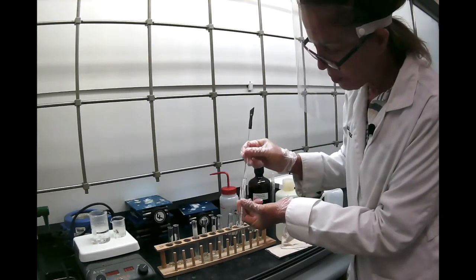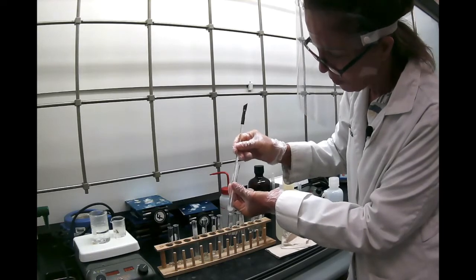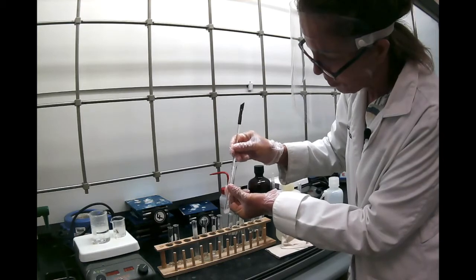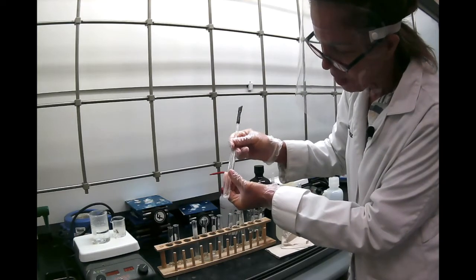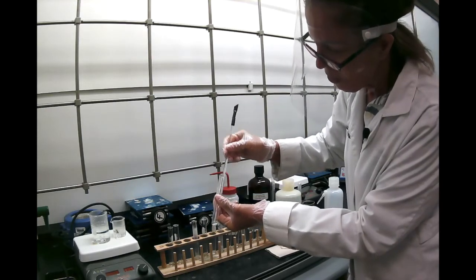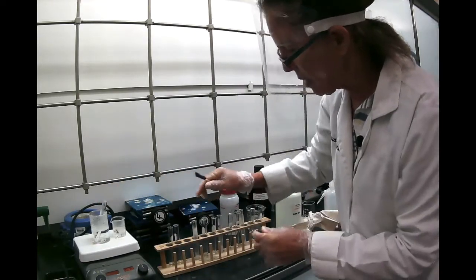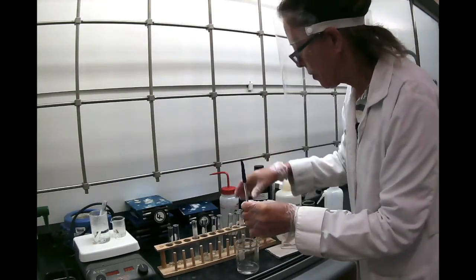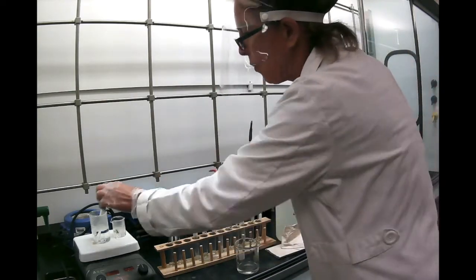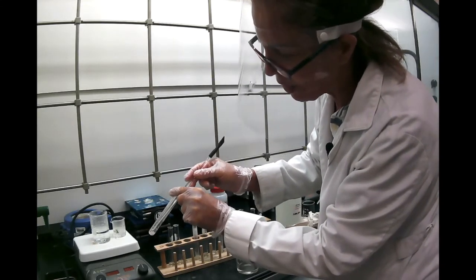So let's look at resorcinol in petroleum ether. Cold petroleum ether, we stir and stir and stir. It's obvious it's not dissolving here. So we're going to put it in the hot water for a little bit. Now, one thing about petroleum ether is very volatile, so we don't want to overheat it here because it will evaporate, and you can see it did evaporate.